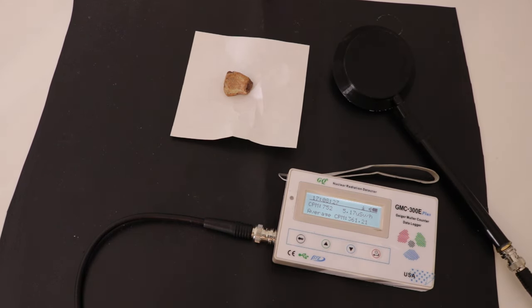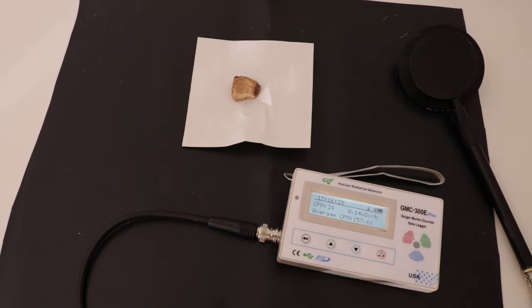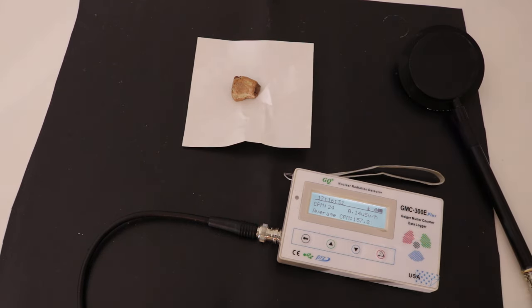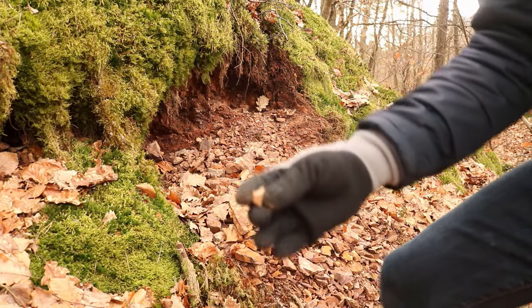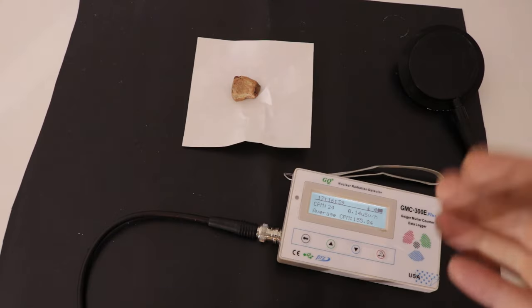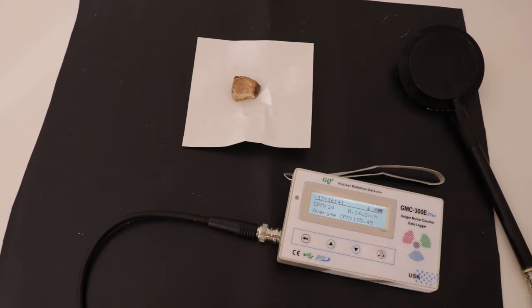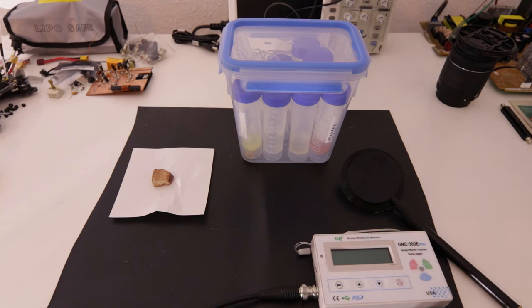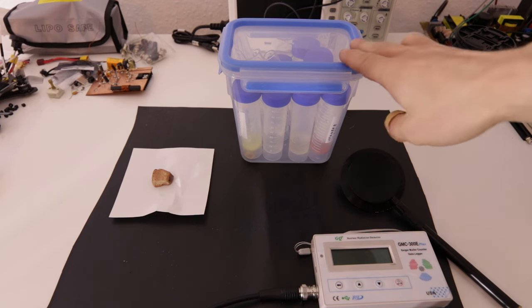In this video I'm going to extract uranium and radium from uranium ore. Now this is just a small piece, but I went uranium mining quite a while ago and I have several kilograms of this stuff. The goal for this project is to get enough uranium out to convert it into uranium metal.